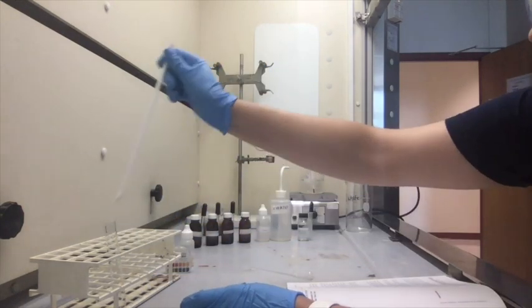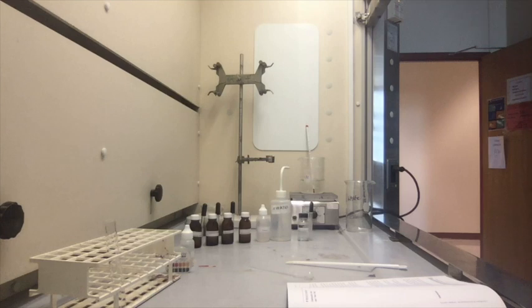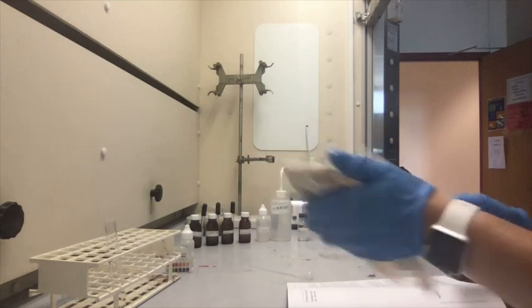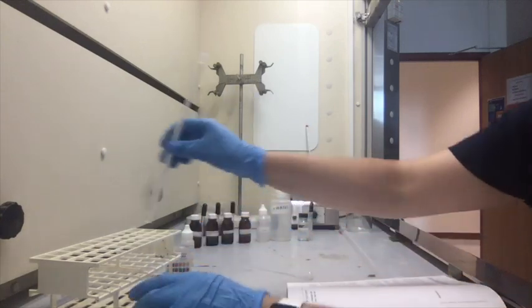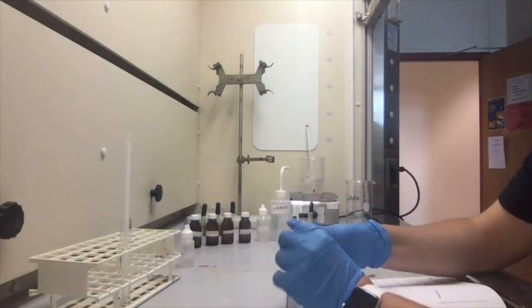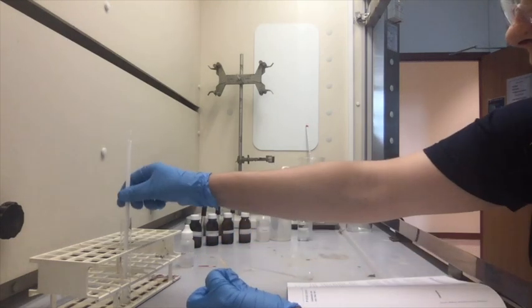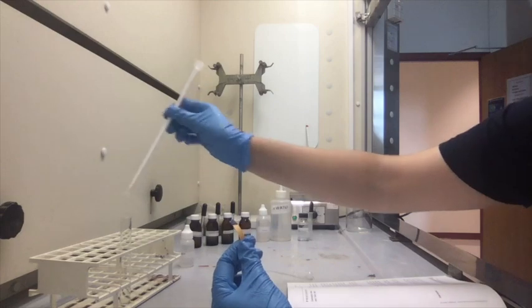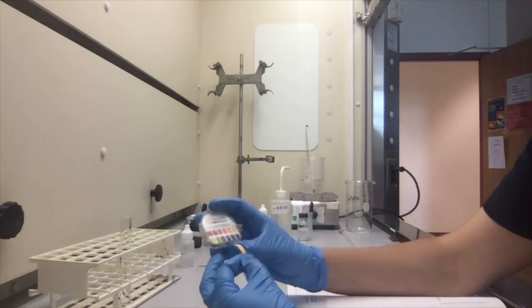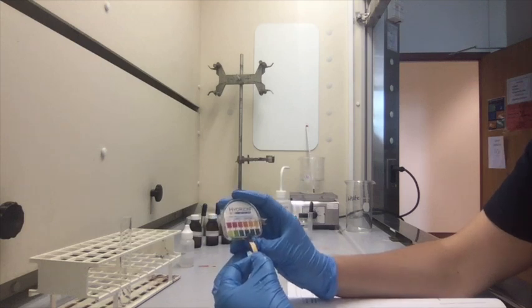Grab this again. Let me grab a paper towel. I'm just going to wipe that down a little bit. Okay. And then we're going to go like this. Kind of mix it up like that. Grab a little piece of our pH paper. So as you can see, it's now very basic. It's probably about a 10 on the pH scale.